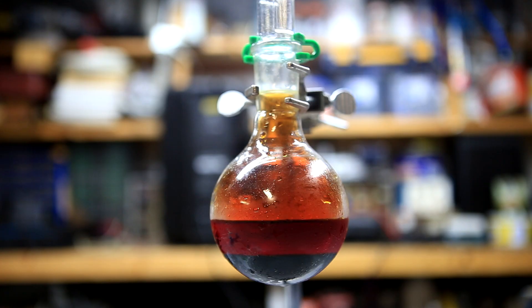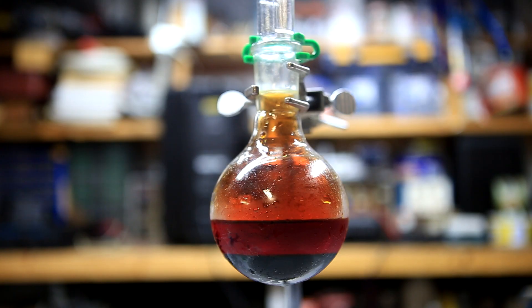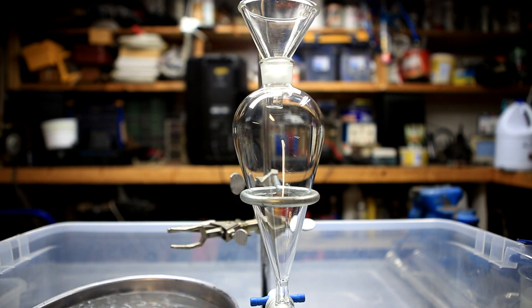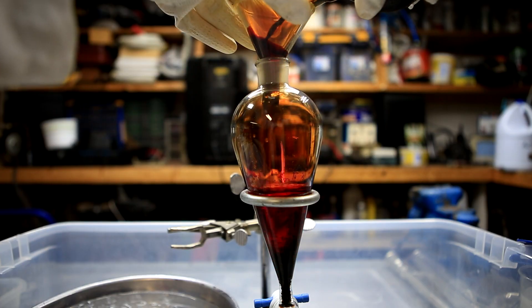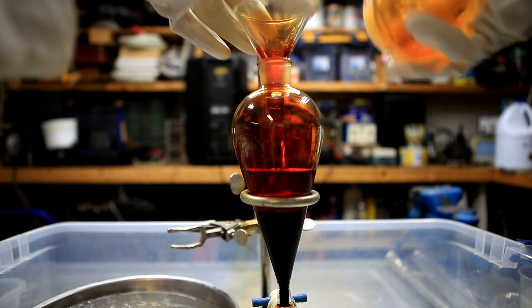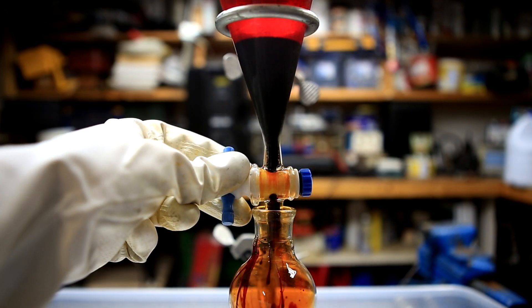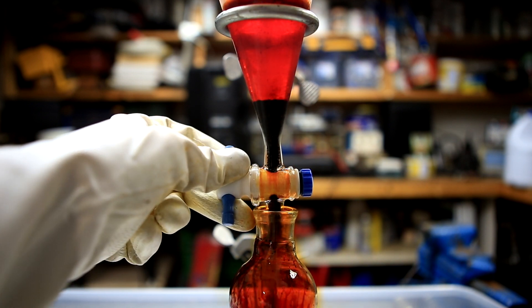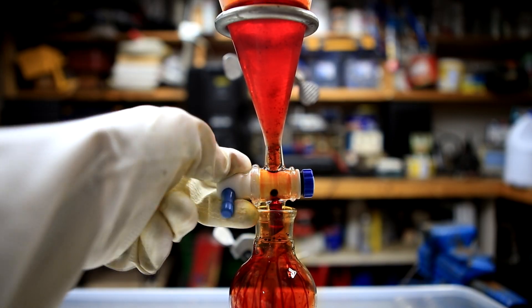This is the final yield of bromine — we have bromine on the bottom and a water layer above it. The bromine is on the bottom because it's three times as dense as water. The bromine was then transferred to a separatory funnel to isolate it from the water. During these steps, a lot of bromine vapor is released, so it's important to do this in a well-ventilated area with a respirator. Once the layers had settled, I drained the lower bromine layer directly into another separatory funnel, because the next step is to dry the bromine using concentrated sulfuric acid.